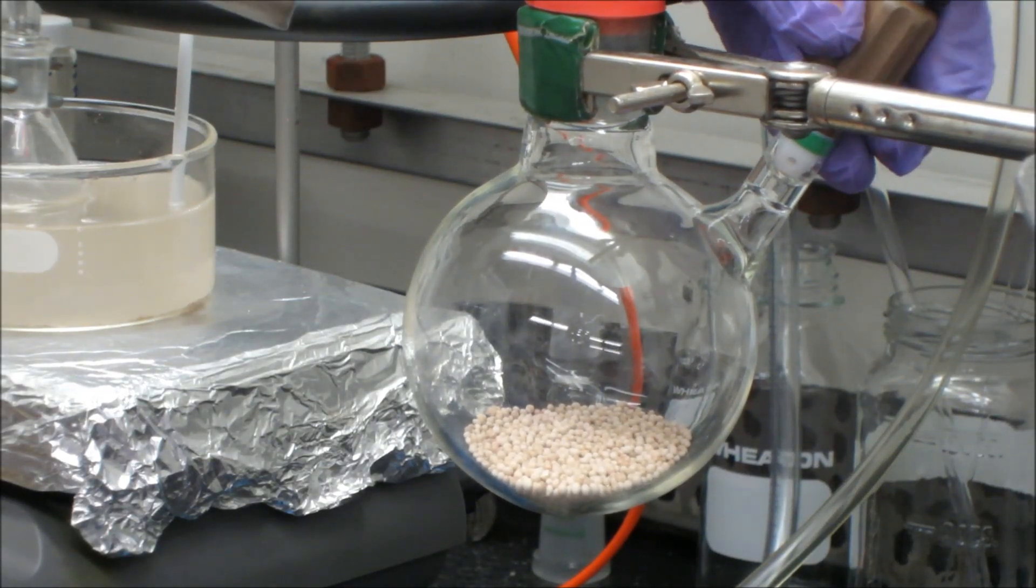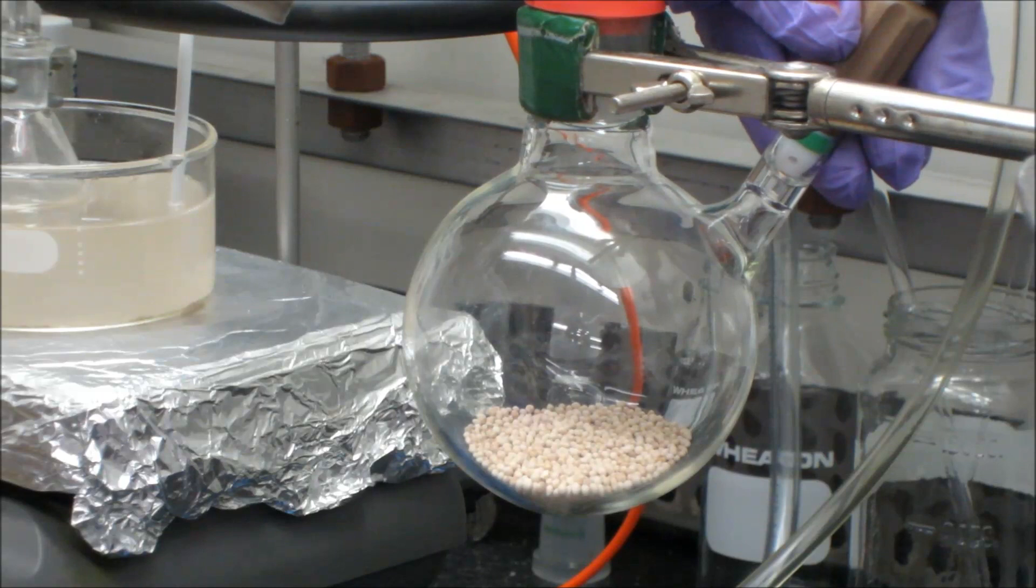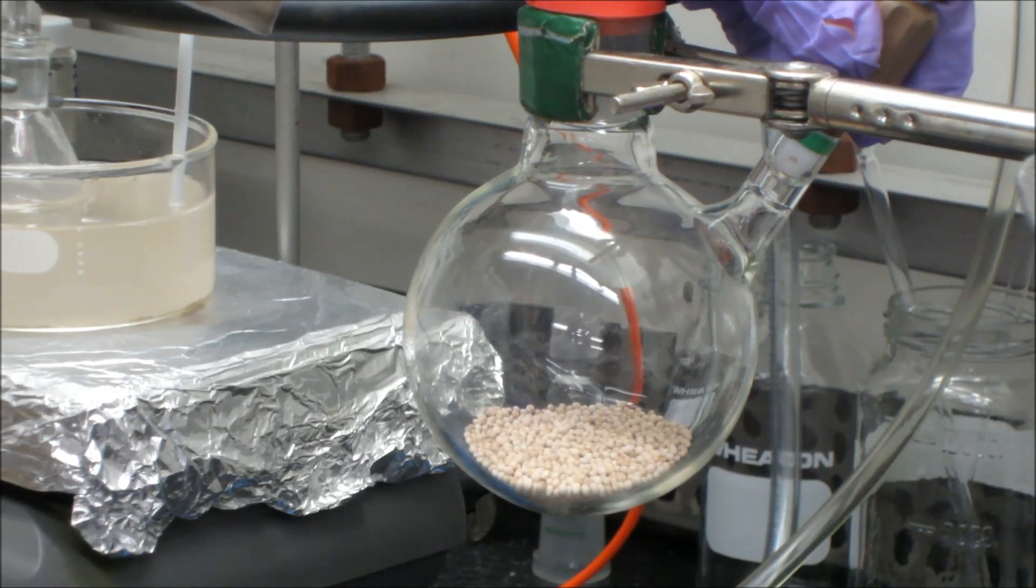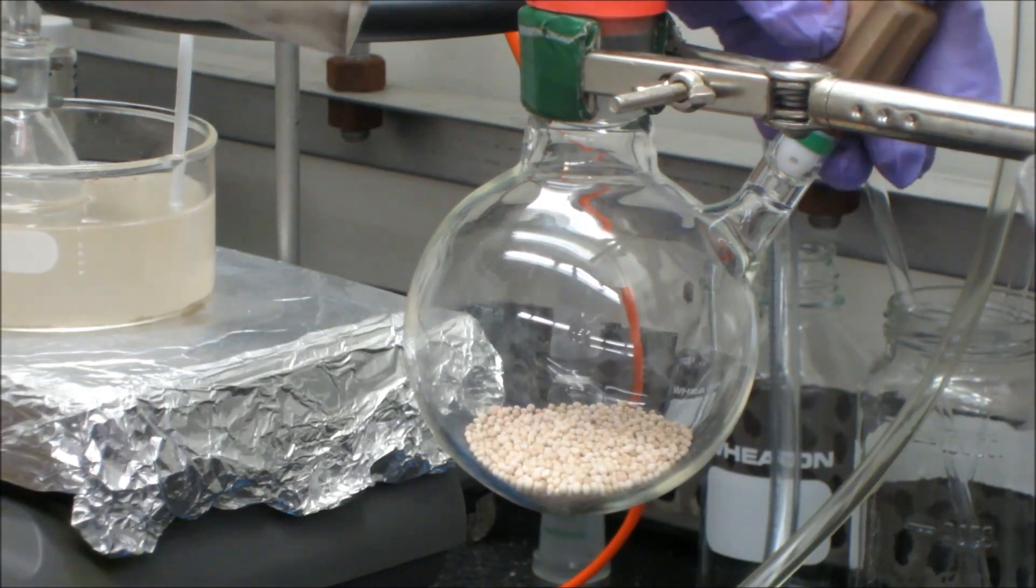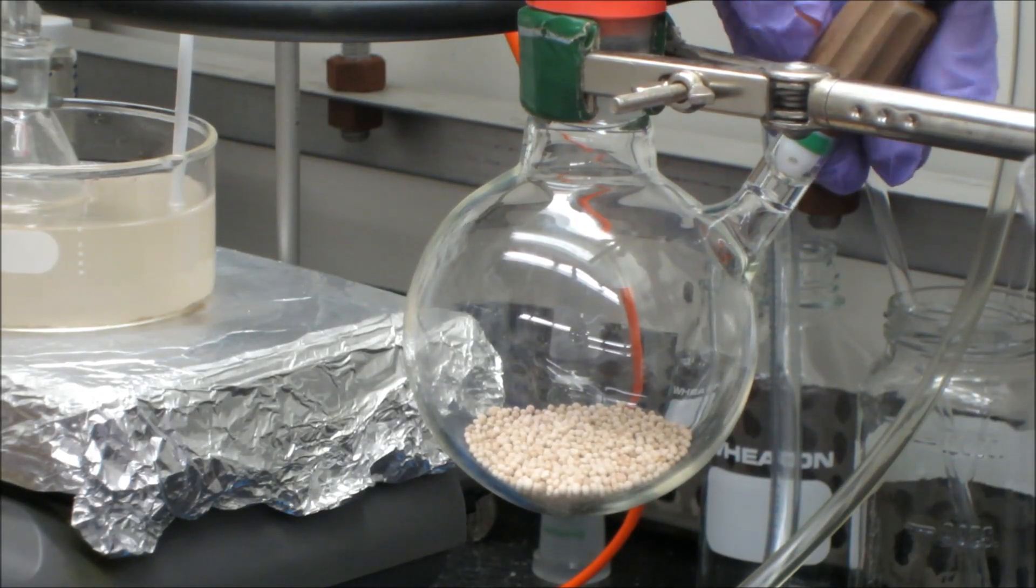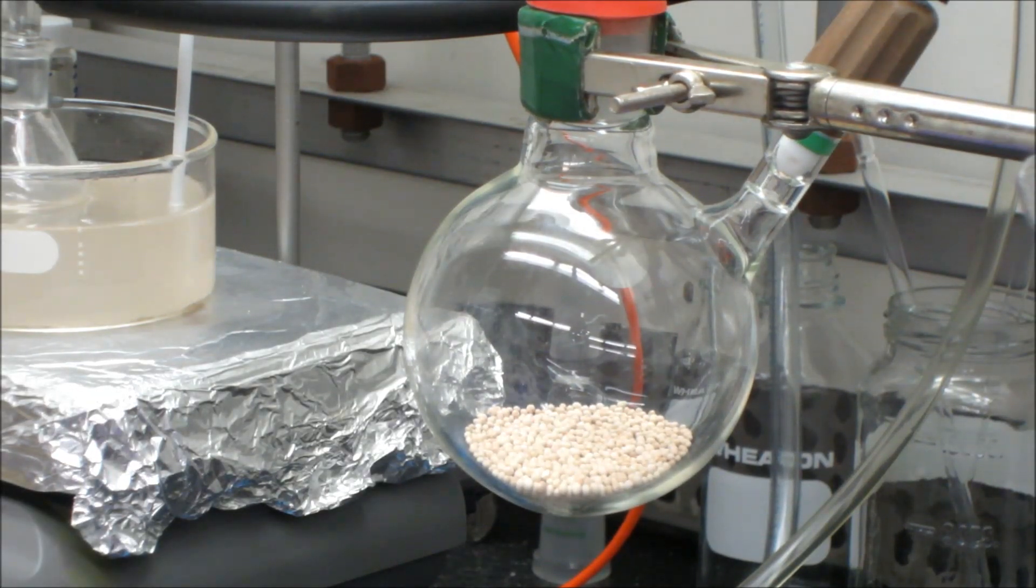So I'm going to make sure this is open a little bit more. Actually, I think the system was probably closed a bit. You heard the pump start humming as I open this even more. And that's just saying that it's actually pulling a vacuum on the flask.